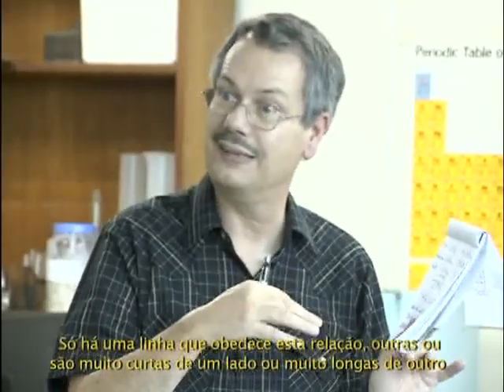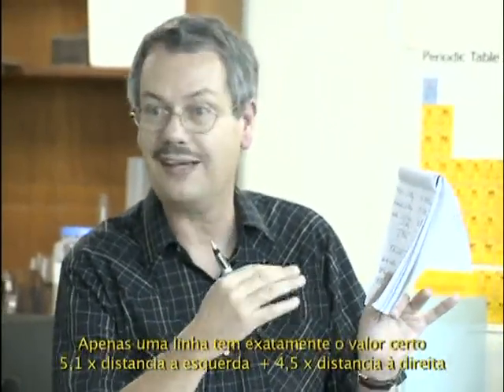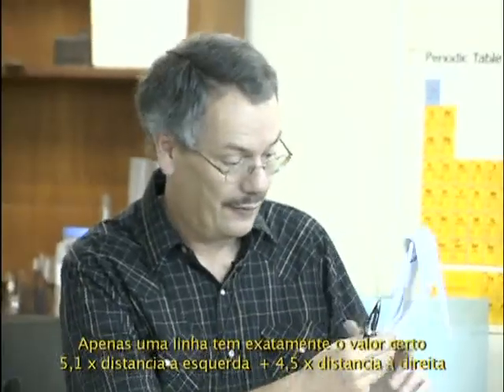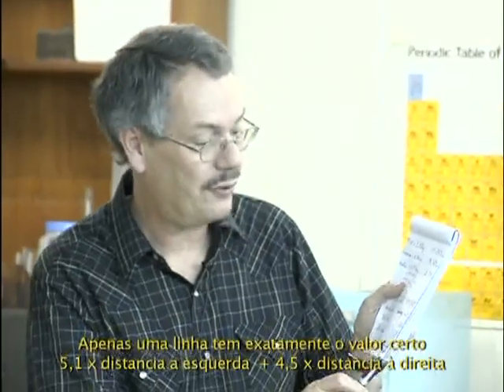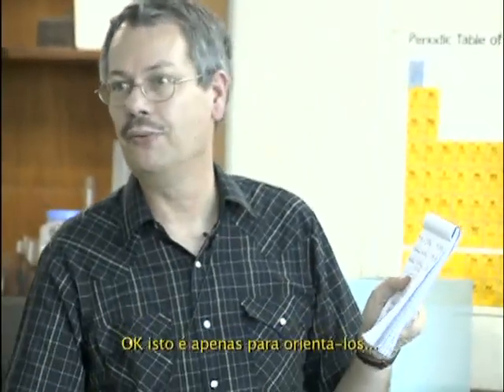All other lines, it's too short on the one side and too long on the other. Only one line has approximately exactly the right value. 5.1 times distance on the left, 4.5 times distance on the right. Okay, so this is to give you an indication.